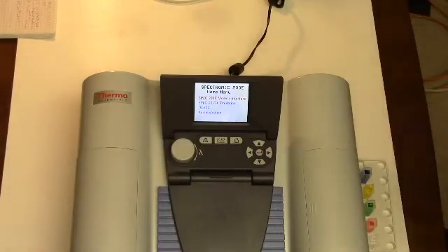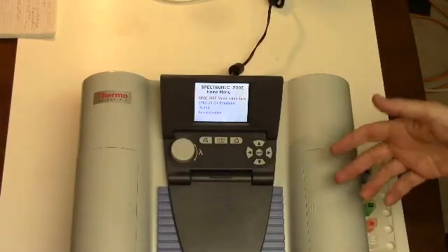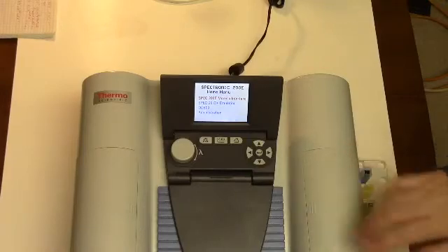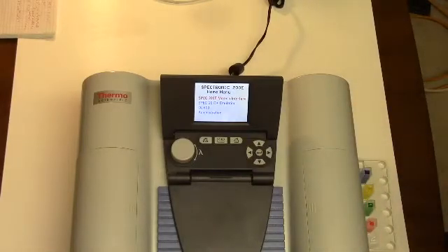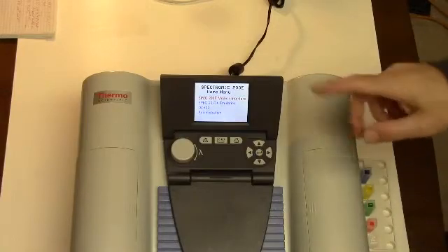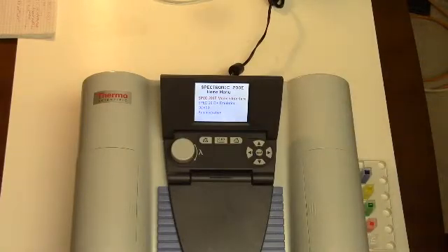Hello, in this lab we are going to be using a UV spectrometer or a UV visible spectrometer. This one here is a Spectronic 200. It can emulate a lot of different types of systems, but we're just going to use the spec 200 interface on this.